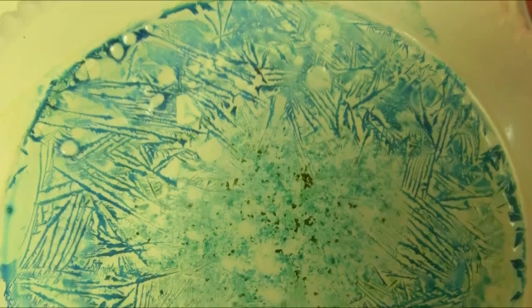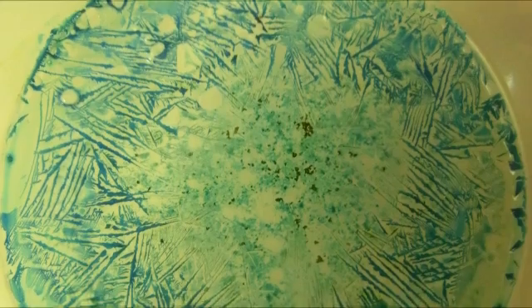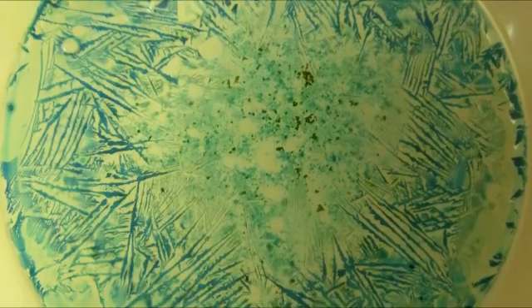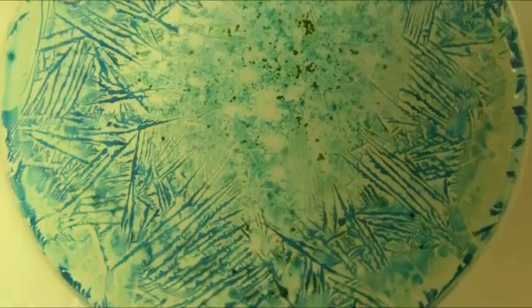I've been doing a lot of experiments lately with crystals and currently trying to grow a huge halite or salt crystal. It's really difficult though because of vibrations and dust and every little variable messes with it.